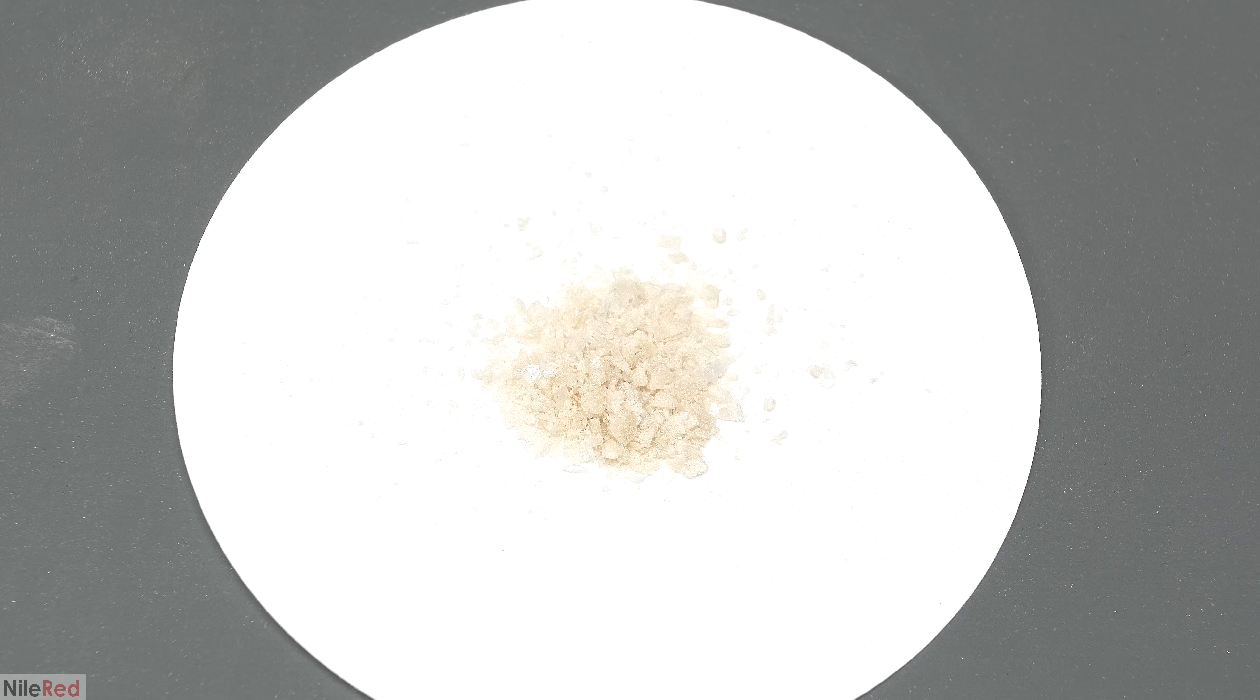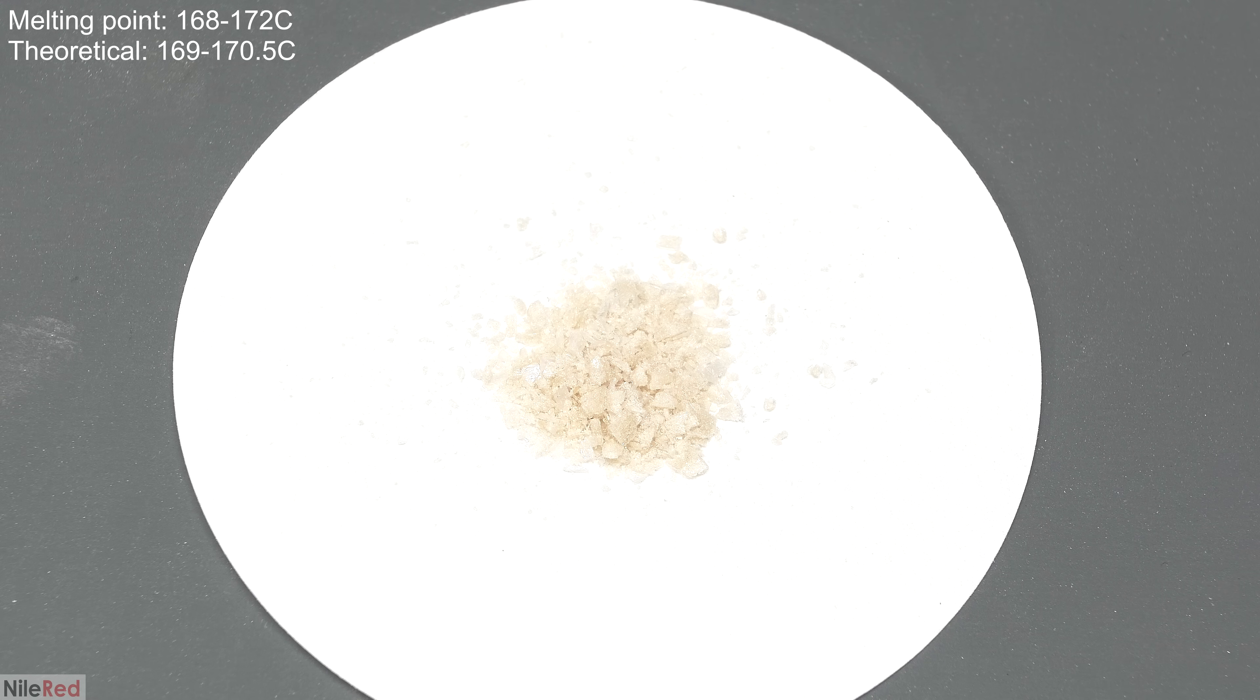When I tested the melting point, it was way off from the theoretical, so I did another recrystallization. After the second recrystallization, the melting point was much closer to the theoretical, but it was still discolored.